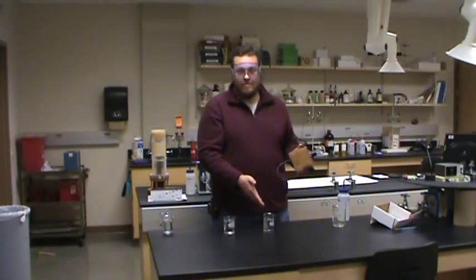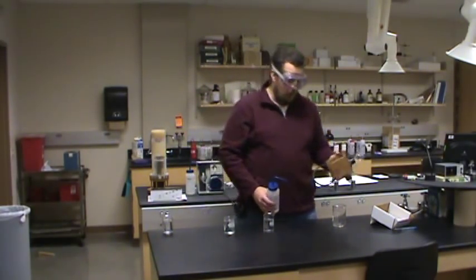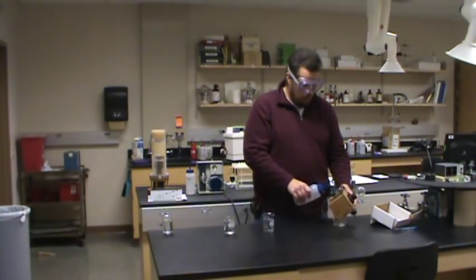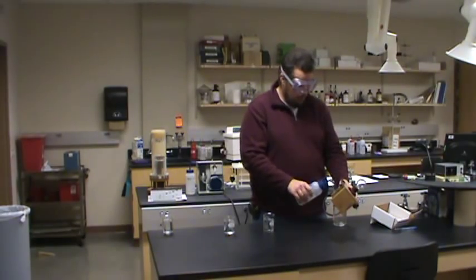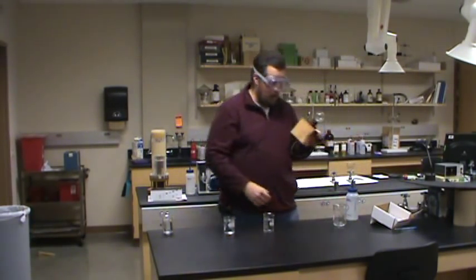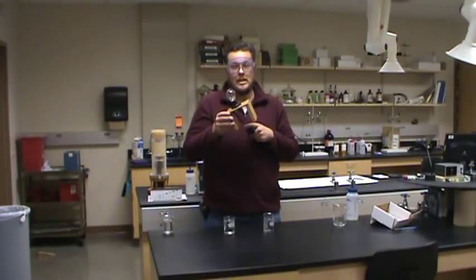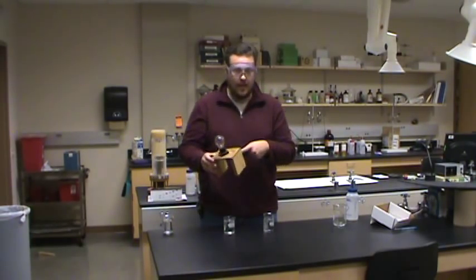Whenever we're using any sort of probe, anytime we move from sample to sample, we always have to be careful about contaminating things. This just came out of deionized water, so it's fine, but it's always good practice to be a little overly cautious. I've got a squirt bottle with deionized water — I'll spray that down, shake off a couple extra drops, and now I know my detector is clean.